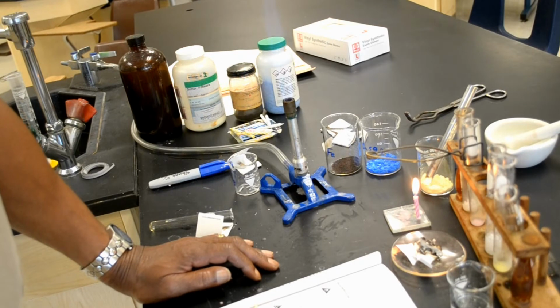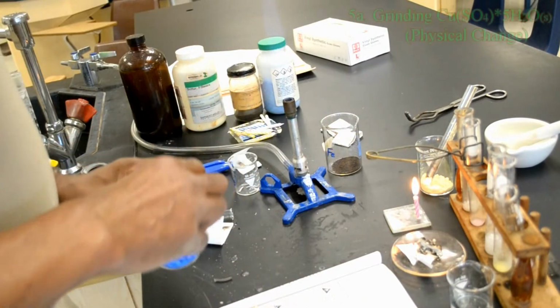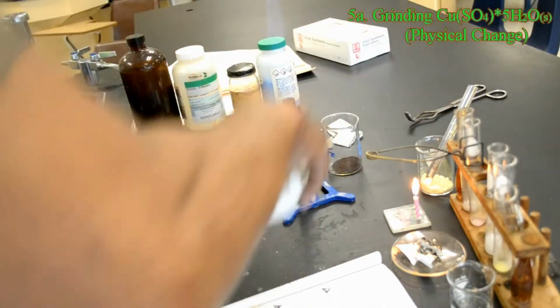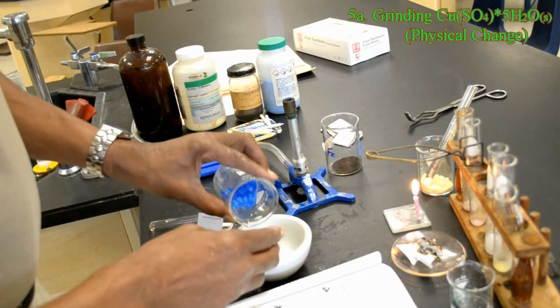Use a mortar and pestle to grind several crystals of copper 2 sulfate pentahydrate into a uniform powder.